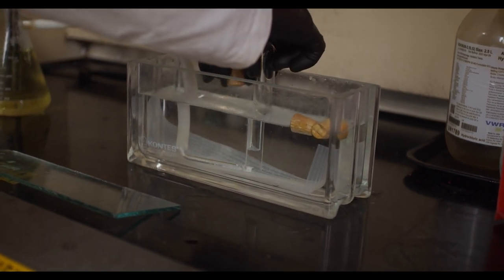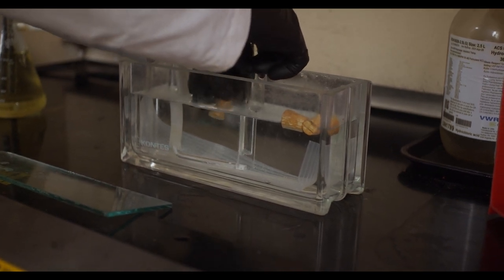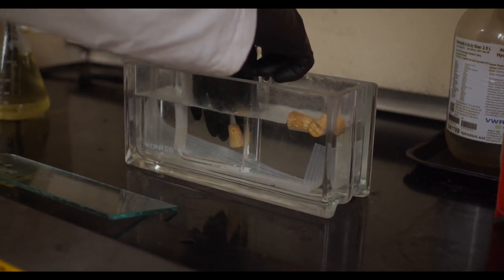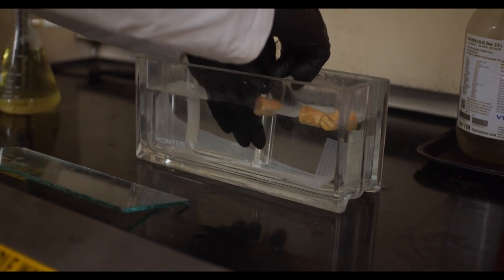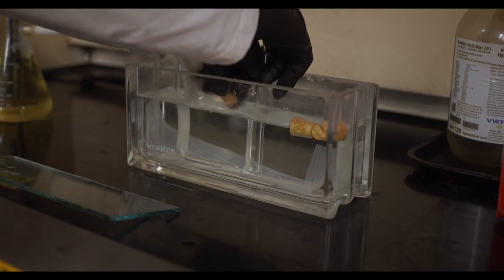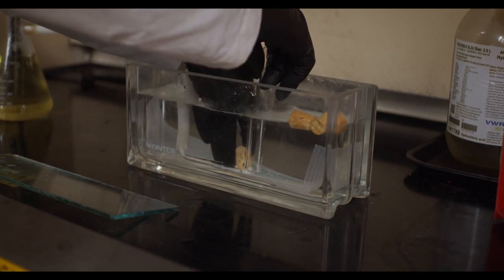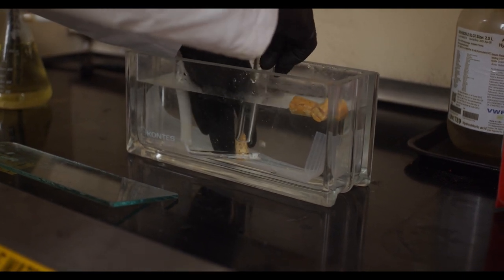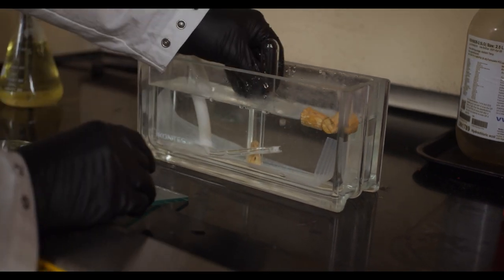the test tube by water displacement. Now, one very important aspect of this demonstration is that the water bath and the gas generator have to run for a number of hours before you start collecting the gas because the water that you start out with is saturated with oxygen.